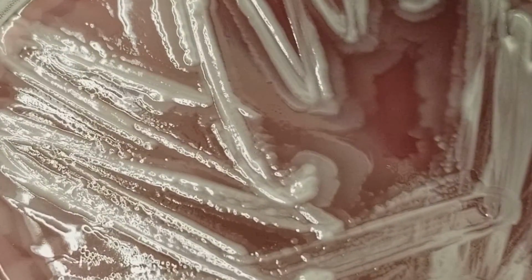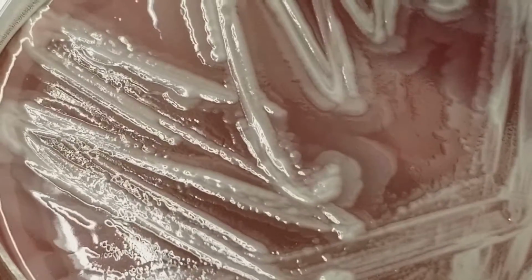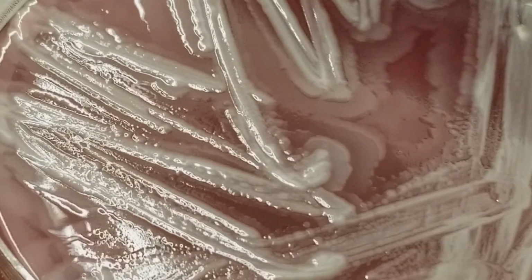And you should smell what I'm smelling on this other end. When you open up E. coli, this is not E. coli, but when you open up E. coli, it has a distinctive smell. So does Pseudomonas aeruginosa. It smells like grapes. I don't really have good verbiage to tell you what E. coli smells like, but certain types of bacteria have definitive smells.